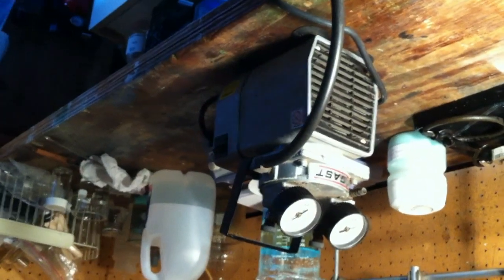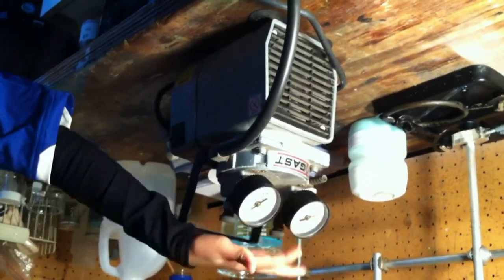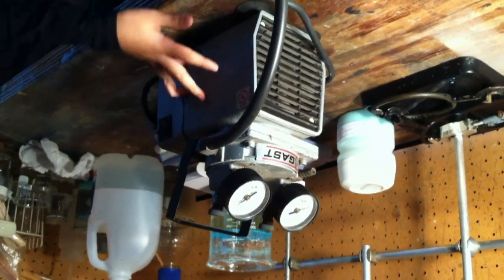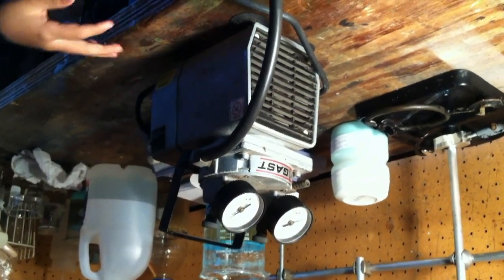Next, you will need a vacuum pump. Here is a vacuum pump. Attach the hose from the vacuum pump to the side arm of the vacuum flask.